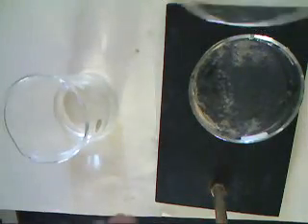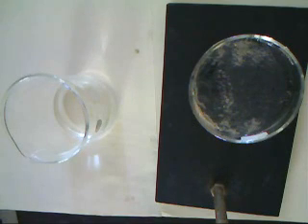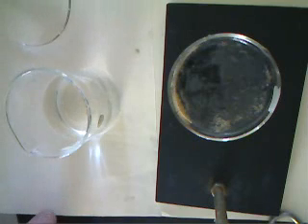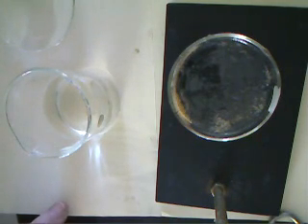That's as much water as we're going to be able to pour off. Now we're going to have to take the sample and put it on the hot plate. We've now washed our second sample in a similar fashion to the first one, gotten all the water off of it we can without losing any of the sand. We now have to put it onto the hot plate.